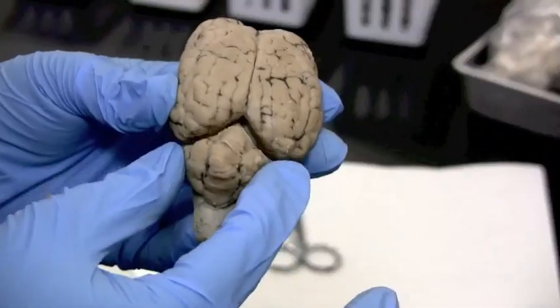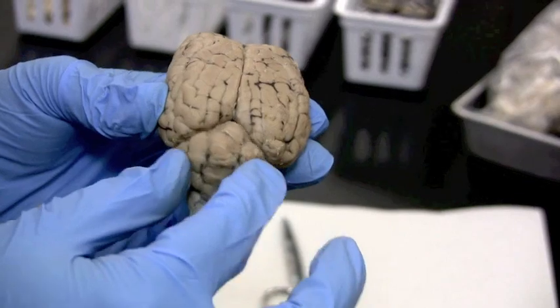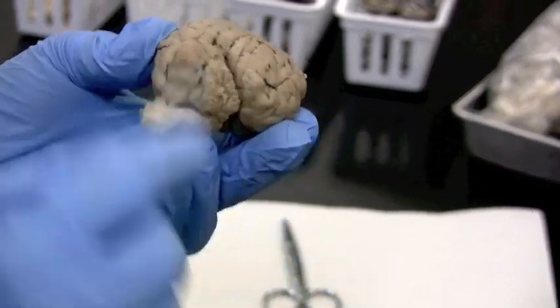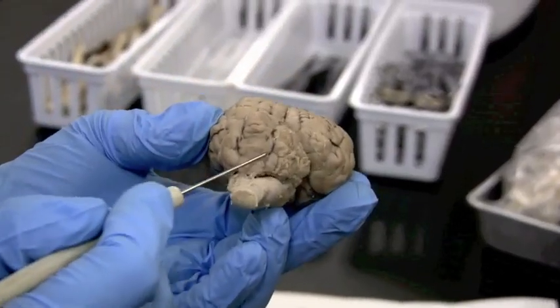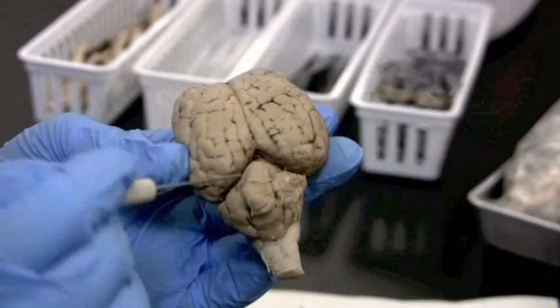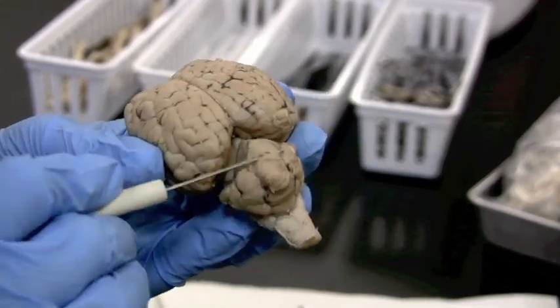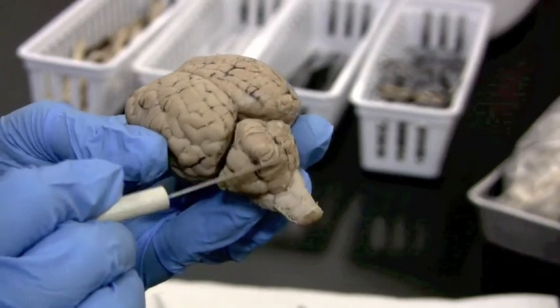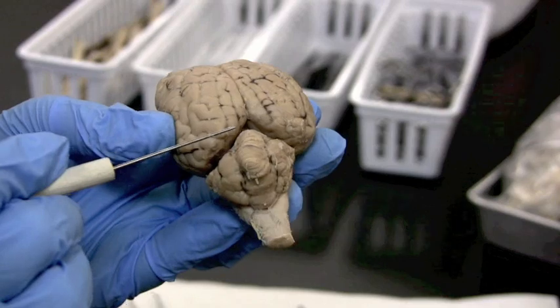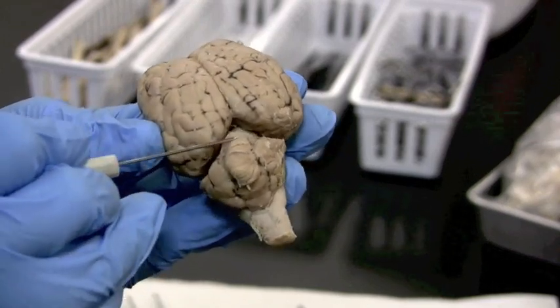You can also see the cerebellum here — what some people call a small brain. Going across and connecting the two hemispheres of the cerebellum are these worm-like structures, the vermis — V-E-R-M-I-S. Those are the worms that connect the cerebellum.